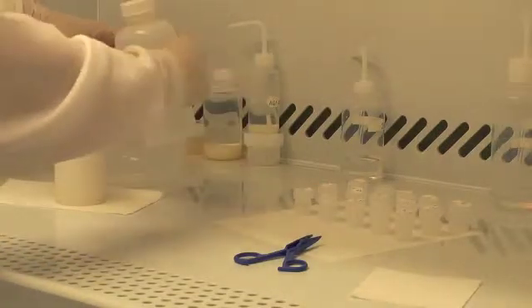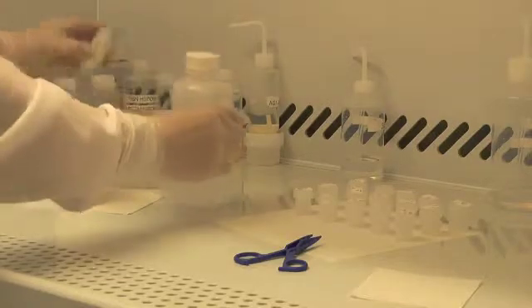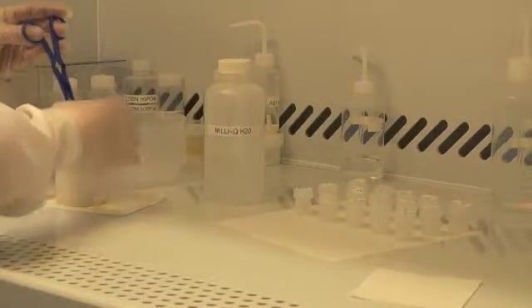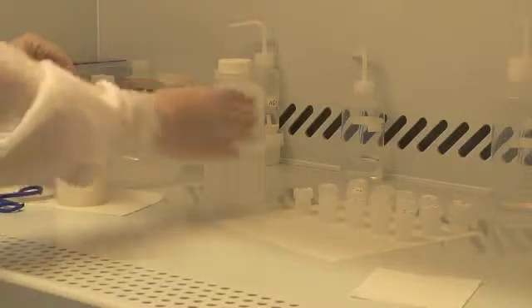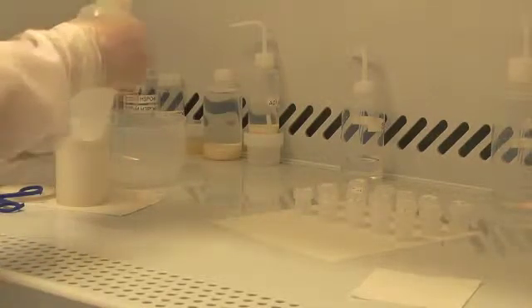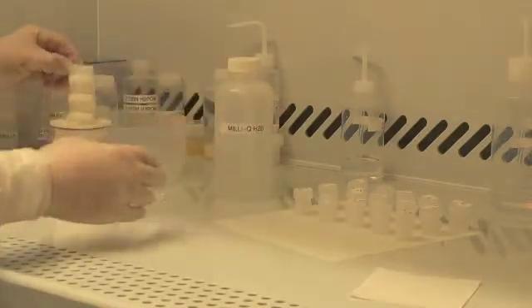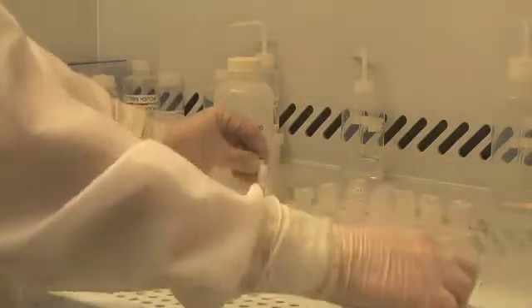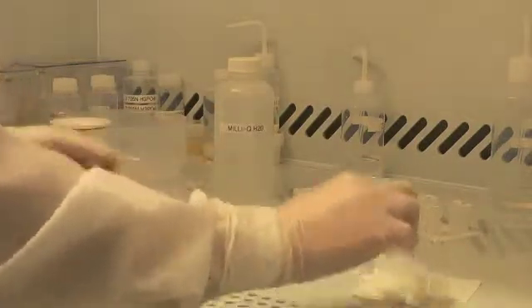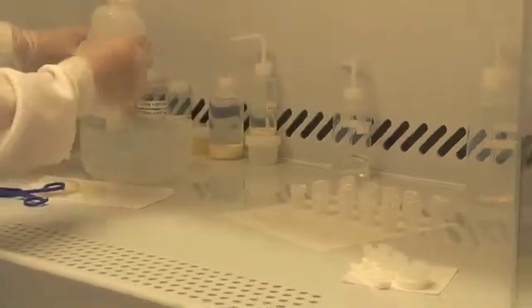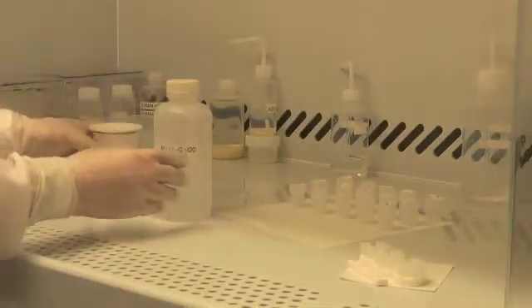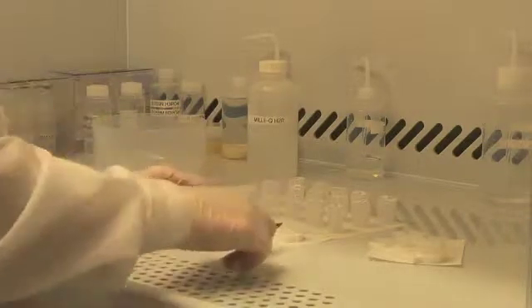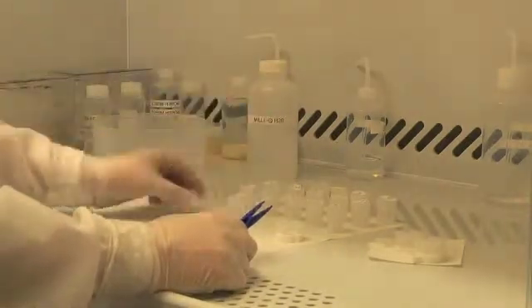I'm going to remove the lid and rinse the hydrofluoric acid from it. Using my tweezers, I'm going to pull the assembly out, rinse it with water, and then disassemble. Discard that hydrofluoric acid and rinse. I'm now ready to transfer the zircon in each microcapsule into the corresponding beaker that we started the process in.